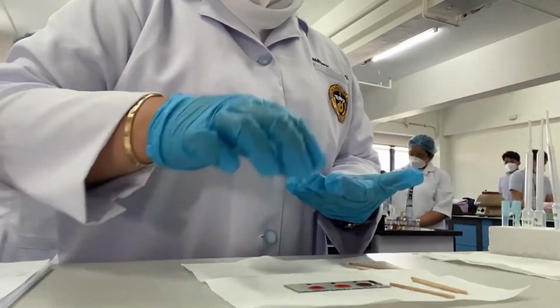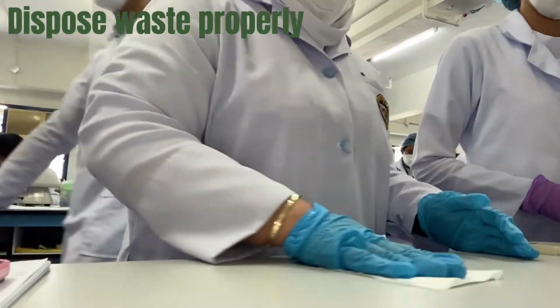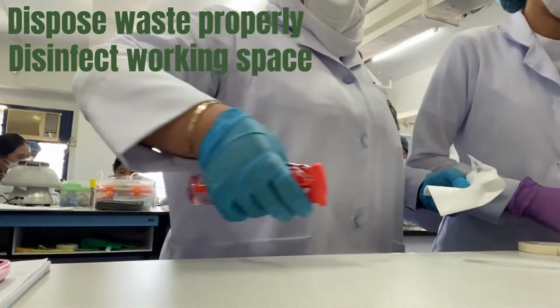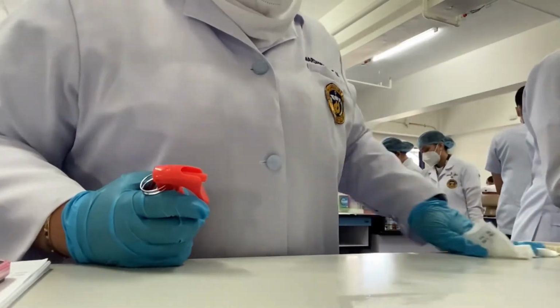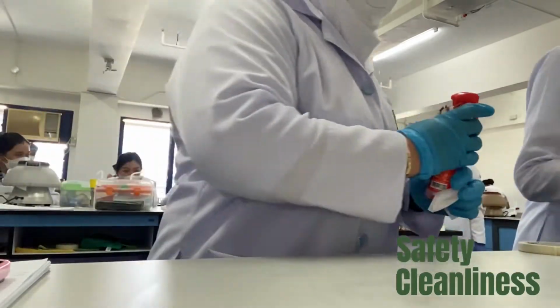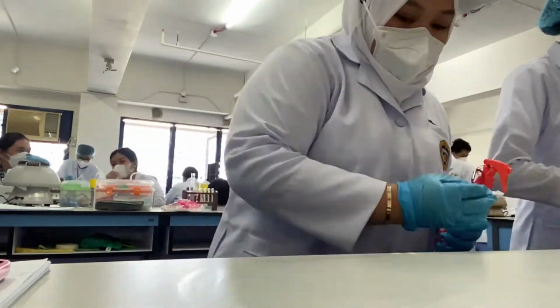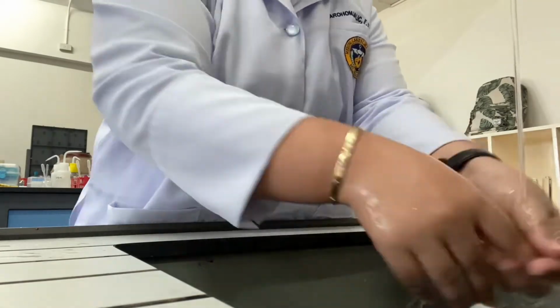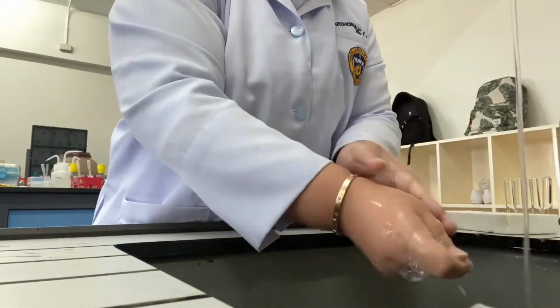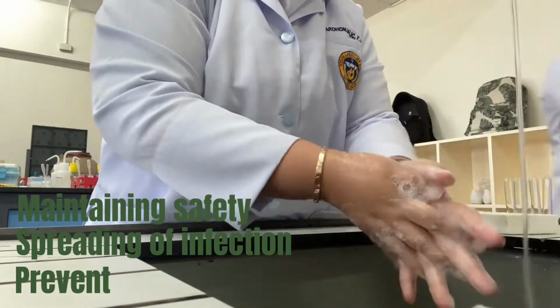After conducting several procedures, we should dispose our waste properly and disinfect our working space. This is to promote cleanliness and safety in the laboratory. And of course, it should end with proper hand washing. Hand washing is important to prevent spreading infection and maintaining safety.